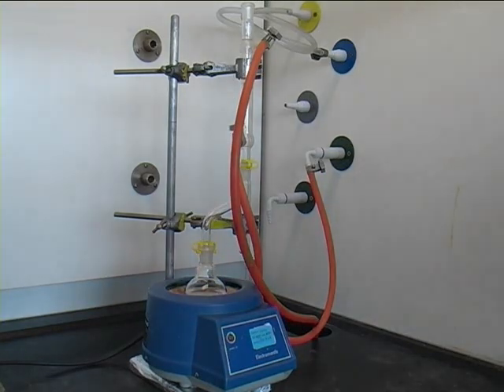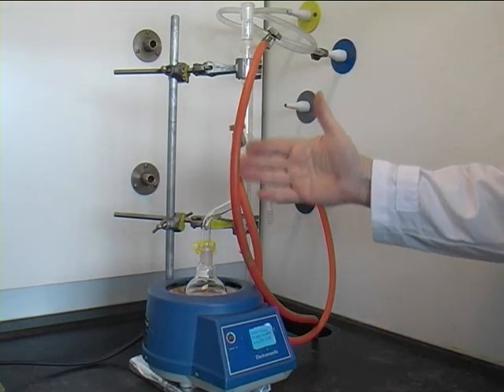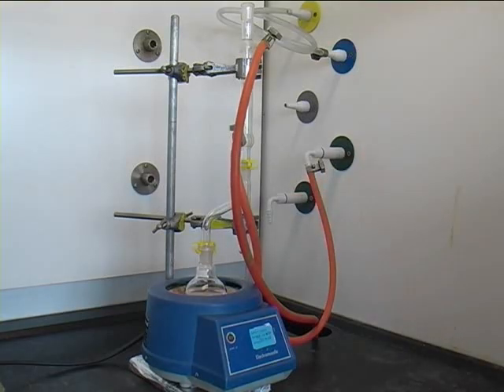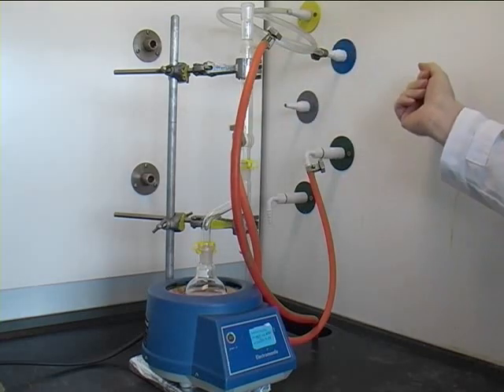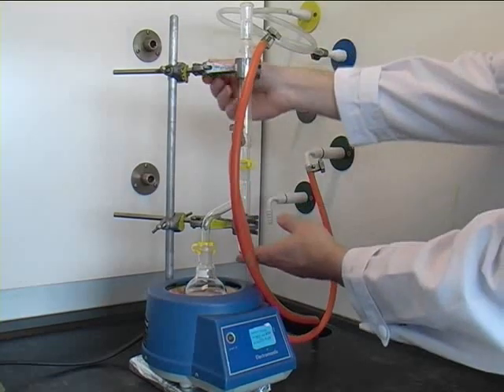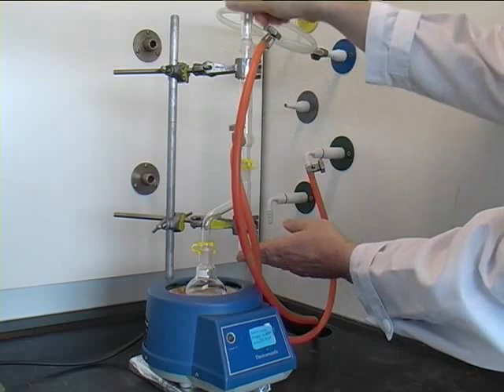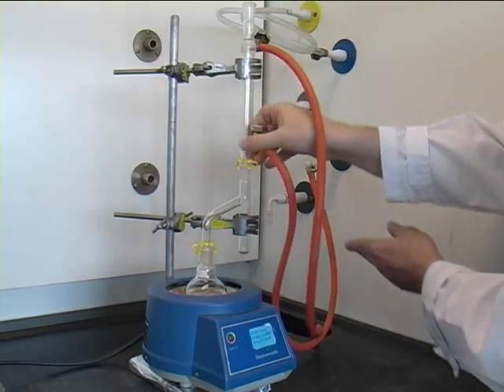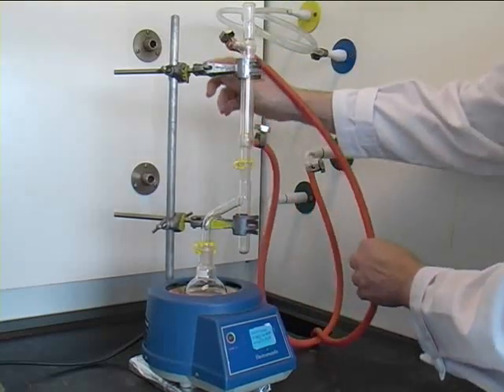Here you can see how it is connected in the fume hood. As you can see, the tubing points a little bit away. It might even bend to the point that the water flow is obstructed. An advantage of the vertical alignment is that you can easily turn the condenser around in a way that no tubing is obstructed.